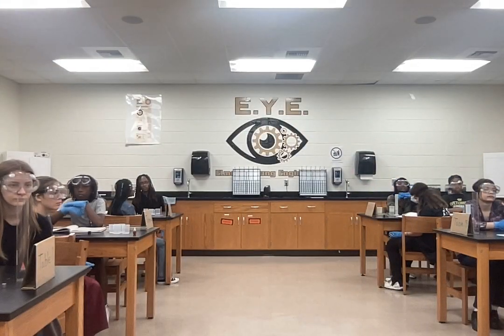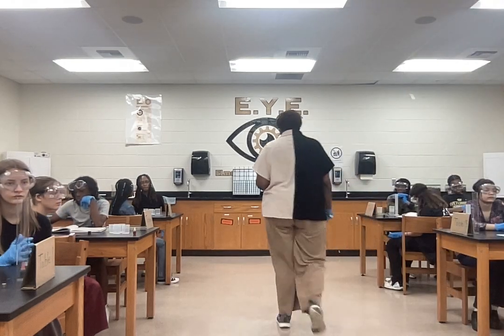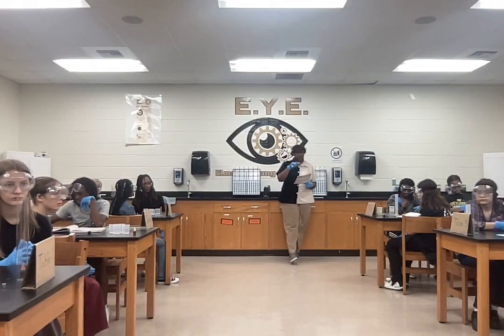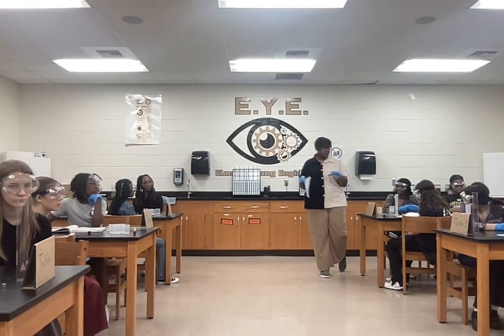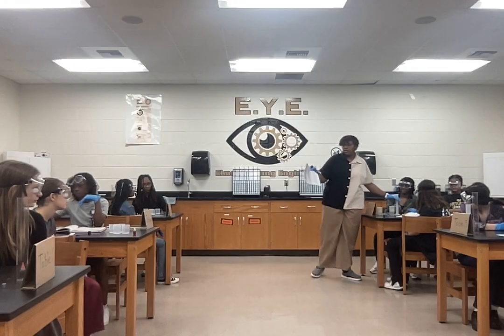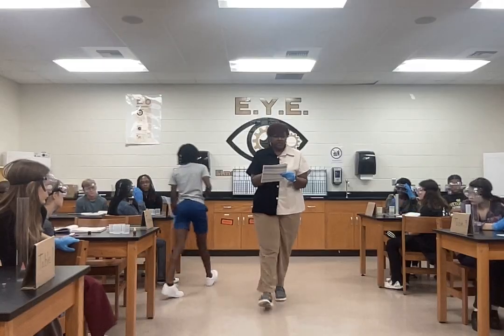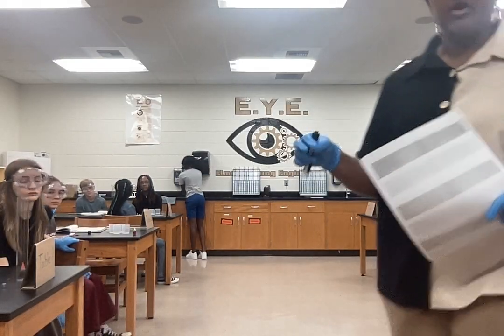Density is going to be mass divided by volume. So to find the density, we want the density of 1 milliliter of water. So we're going to take the mass of the water divided by the volume of the water. Does that make sense? We will do that when he gets back in here. Now, to save us some time, because I really want to get to the fun part, Haley's group, add 25 more milliliters so we're up to 50, because we also have to look at 50 milliliters of water. And while they're doing that, let's set up our graph, okay?